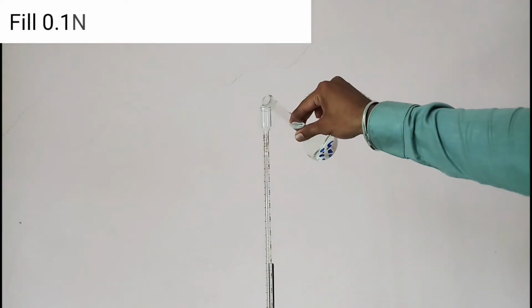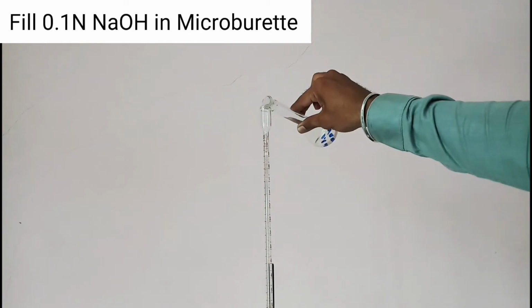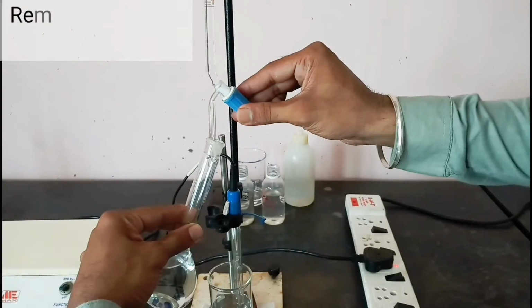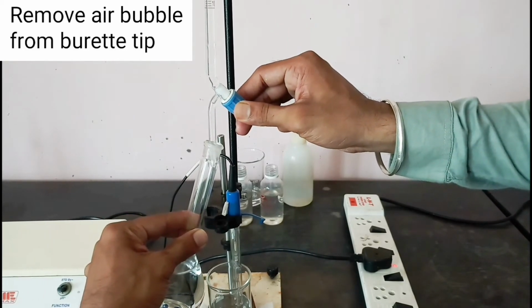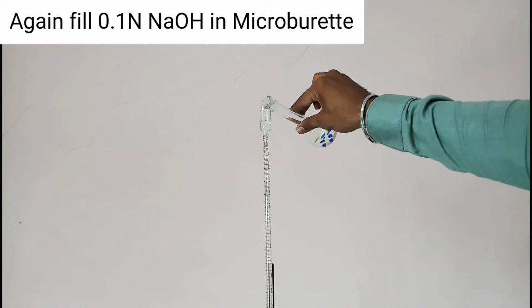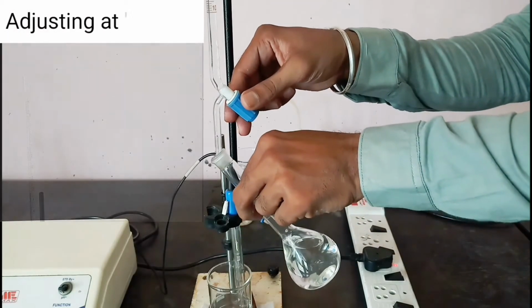Now fill 0.1 normal NaOH in the microburette. Remove the air bubble from the burette tip. Again fill 0.1 normal NaOH in the microburette, adjusting at the 0 mark.